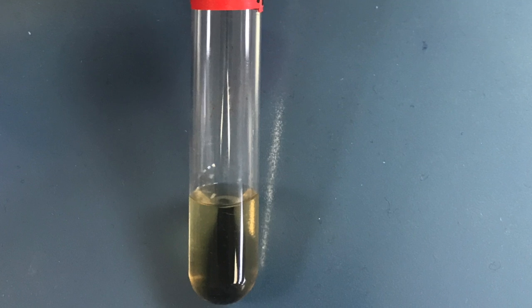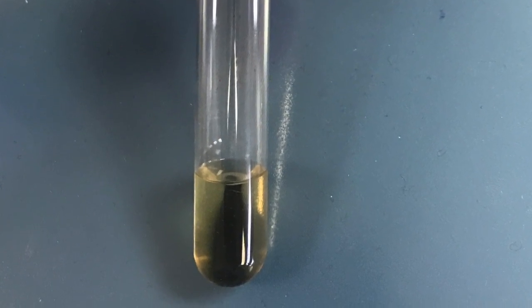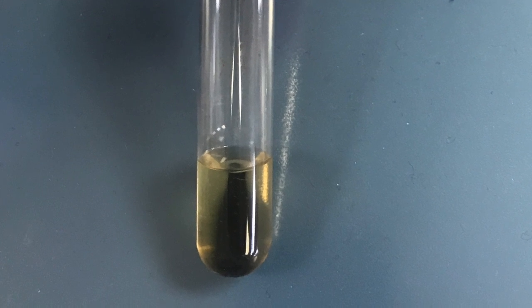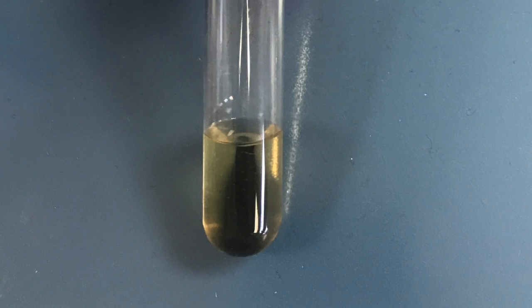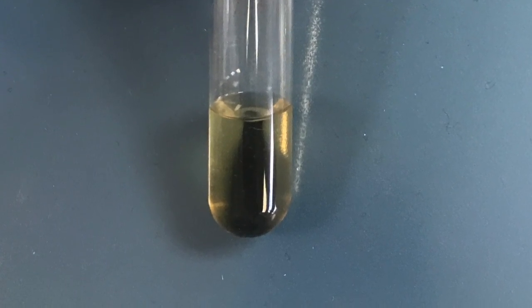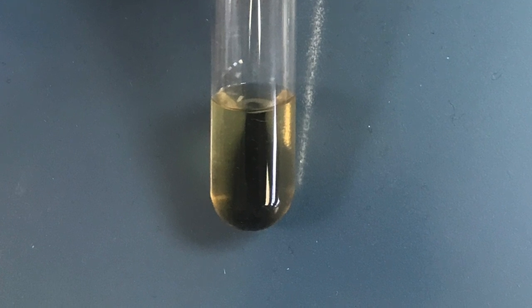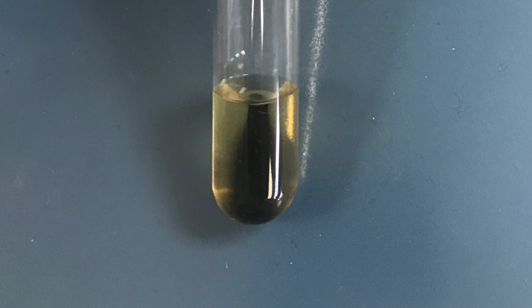We know it is positive for motility because the black growth grows bigger towards the butt of the test tube. A positive motility test shows us that our unknown can move spontaneously, consuming energy in the process. We know that our unknown is negative for indole because when we placed the indole reagent on the top of the agar, it didn't create a pinkish film. This means that it can't hydrolyze tryptophan.